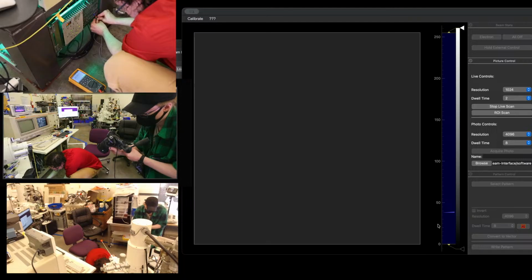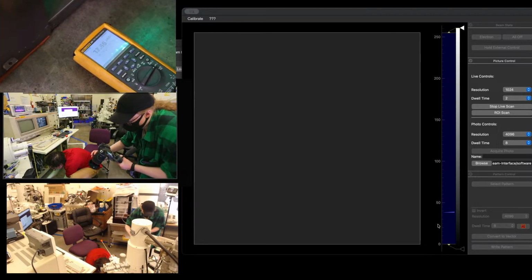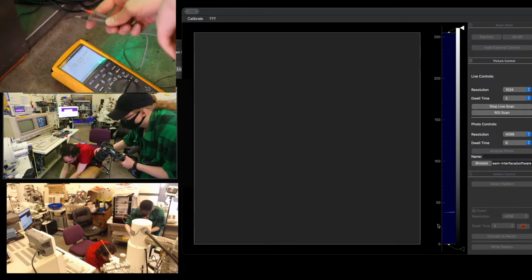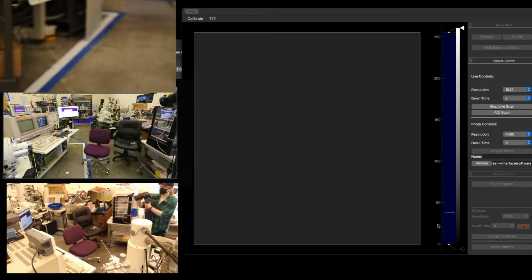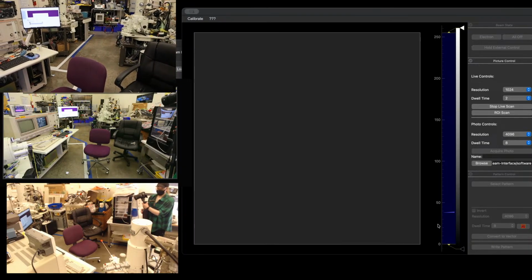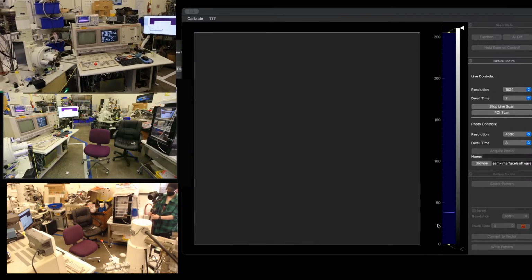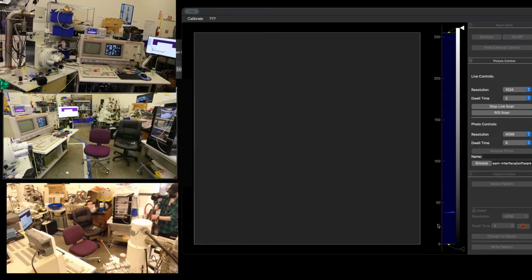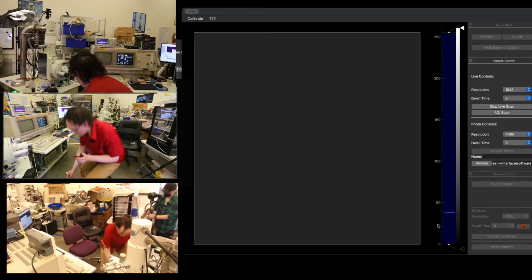If it's moving around like this, or the pressure's just going up like this, that's not good. I'm gonna get better probes for this purpose, because the reading is unstable now. I was thinking if I could get away with just holding the probes on, that'd be fine. I could get the information I need, but now the question is was the probing bad, or is the gauge actually unstable? If the gauge is actually unstable, we've got to figure out what's going on with that. How are we doing on time? We're doing pretty good. We got just a little bit longer.